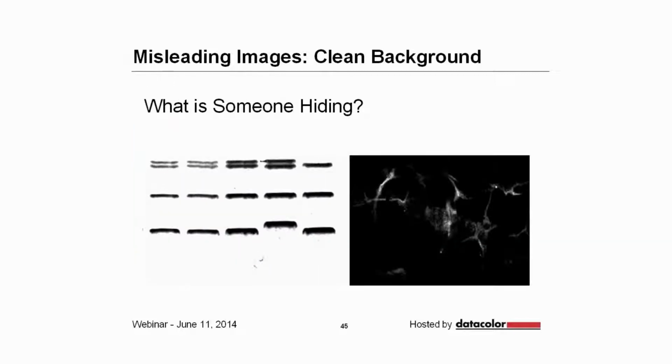This one is really actually way too typical. Clean backgrounds. And by this what I mean is that you've made the background so white that it's like, wait a second, what are you hiding? Is there a faint band in there that you don't want me to see?